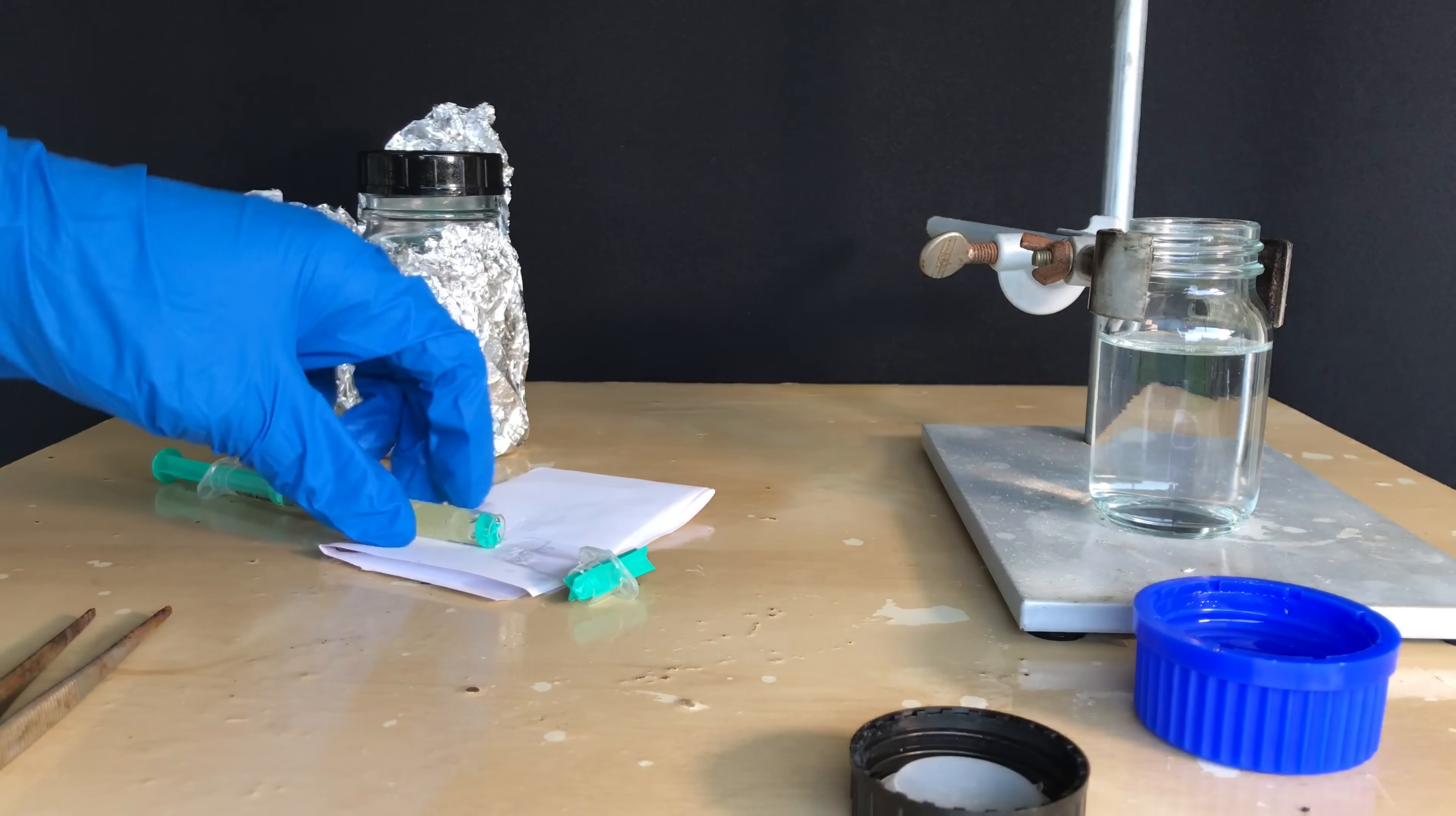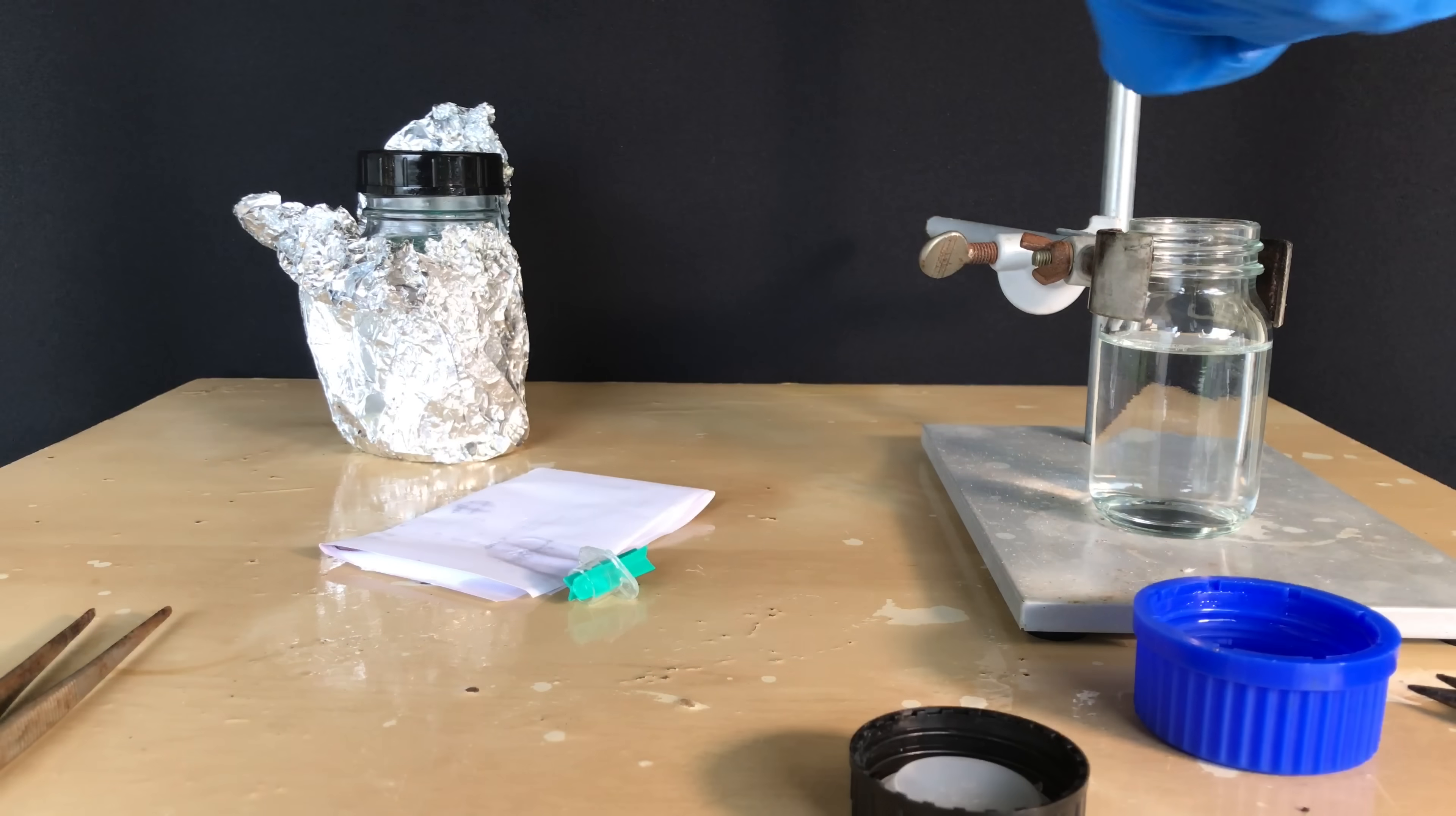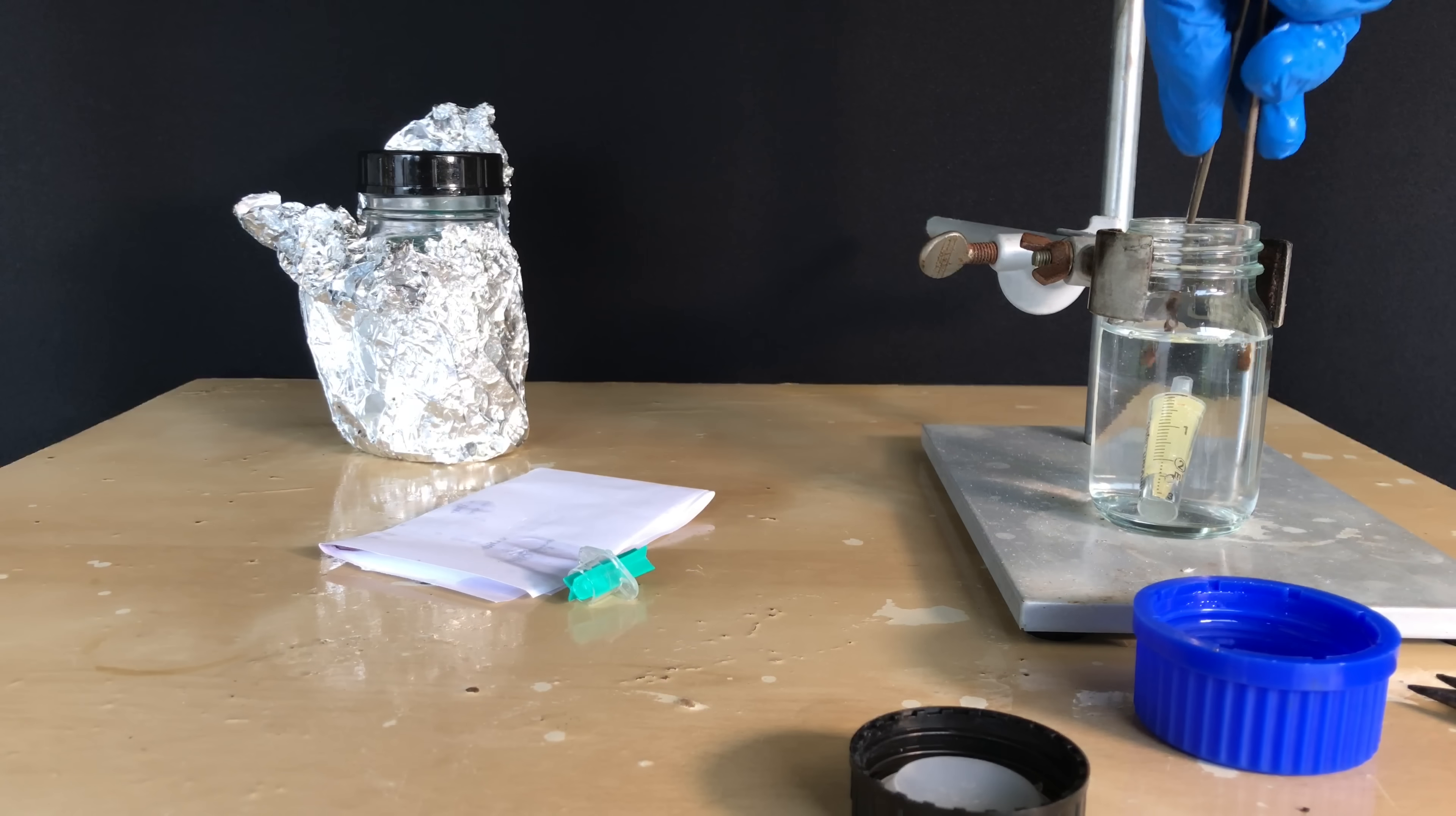And there you go, you can have a look at our white phosphorus. The next day I decided to remove it from the syringes by using another water filled syringe to push it out. As you could see, this ended up being harder than I thought it would be.